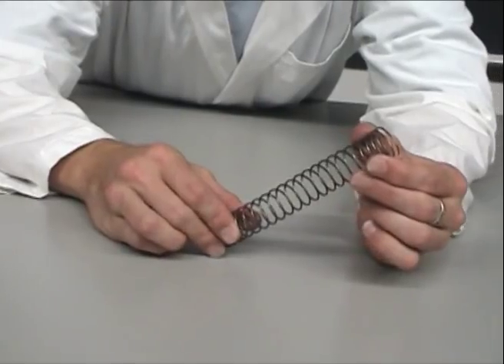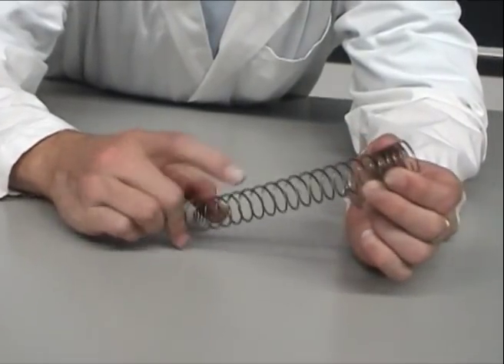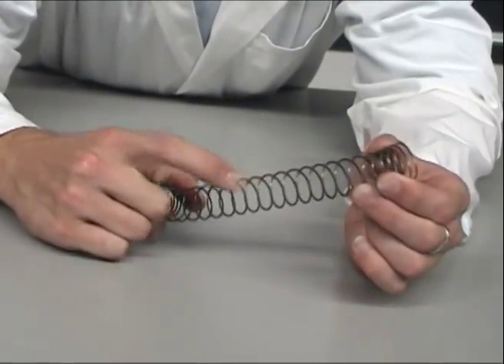Now that I have my image, I can make various measurements on the helix I photographed. I can measure its pitch, or angle, and from this angle, I can measure the spacing between the wires, from the distance between the marks.